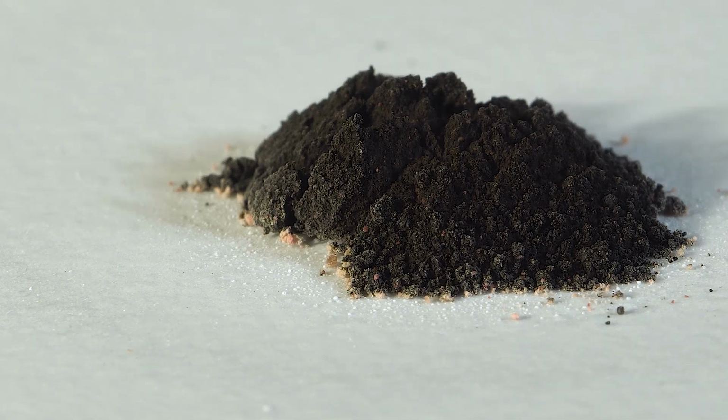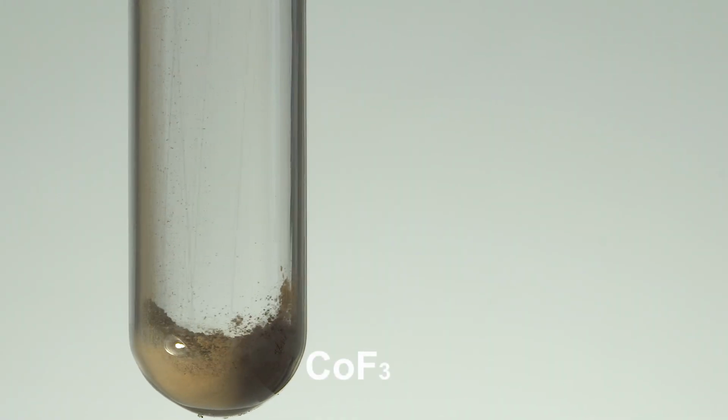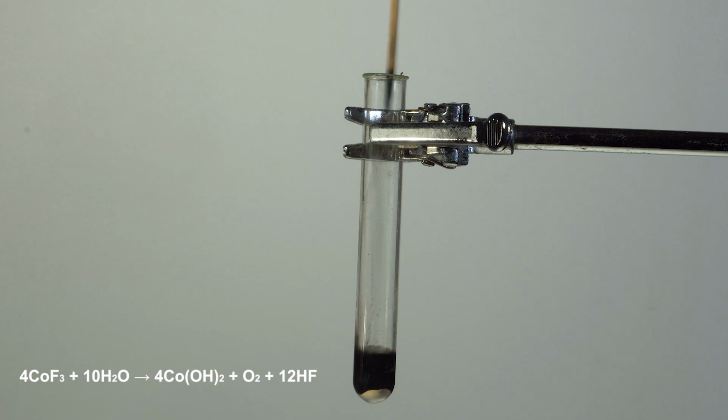And it becomes black the next day. Cobalt trifluoride reacts actively with water to produce hydrogen fluoride and oxygen, and we can detect the latter by dropping a glowing splint in there.